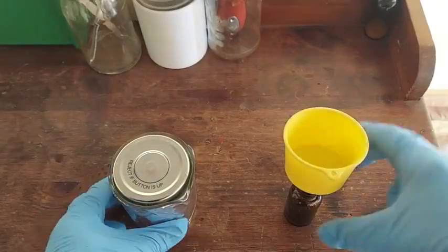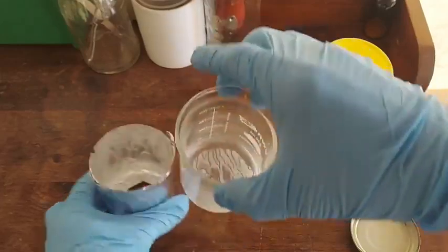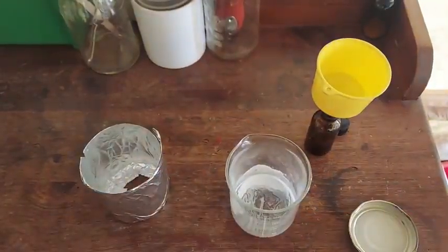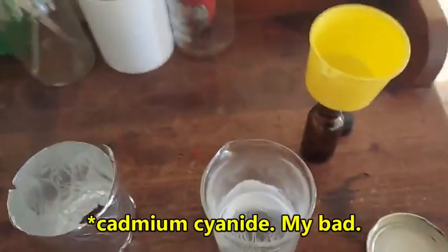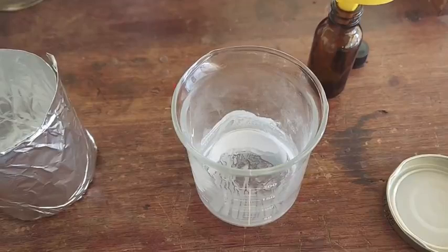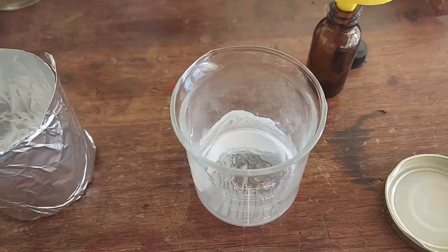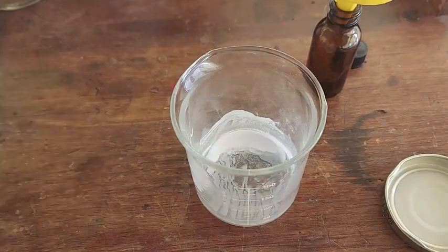The thallium cyanide has been drying out indoors in the desiccator for a couple of days. I put it in there just to be on the safe side in case the thallium cyanide decided to be difficult with the whole light thing, although it does not seem to be. Thallium salts are technically photosensitive - at least some of them are. But one trend I've noticed is that it seems to be a long-term thing. I've only seen them start to change color in the short term once, and even then the color change was not what I would have expected from a photo decomposition.